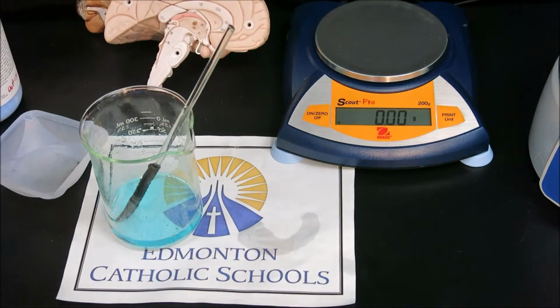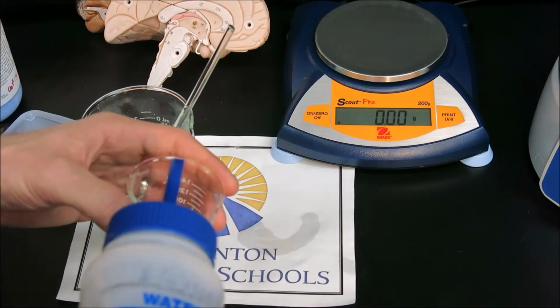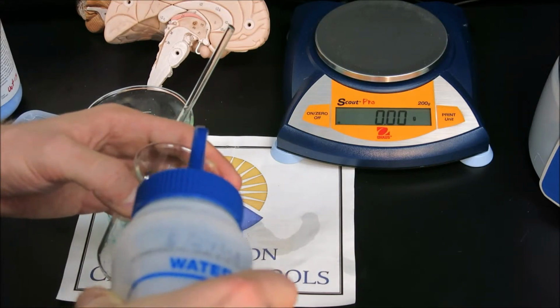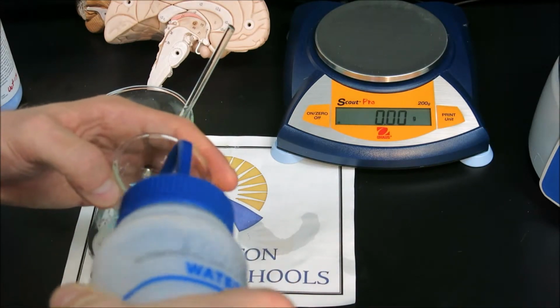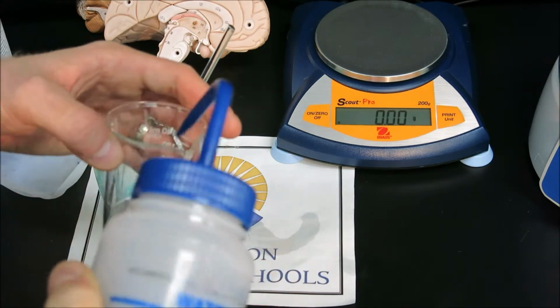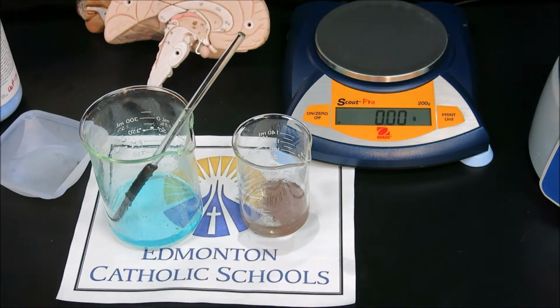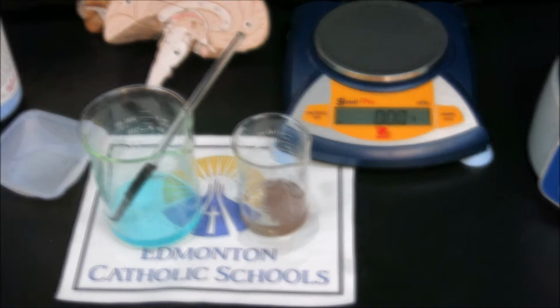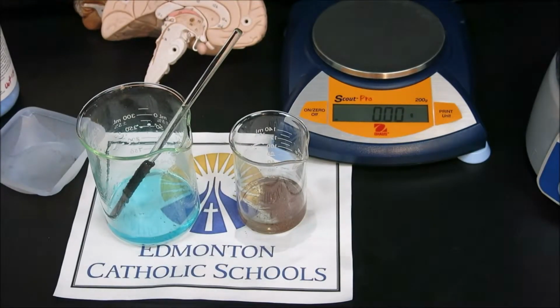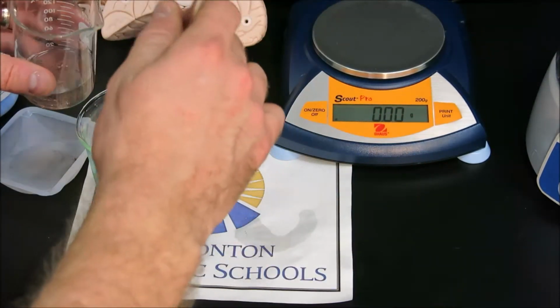So we're going to do another rinse using distilled water and getting down the sides of the container. This will be our final rinse here. So we now let that settle one more time in order to allow it to decant a little easier, and then we'll dry our copper. At this point we're going to decant for the third and final time, gently pouring off this top water layer.